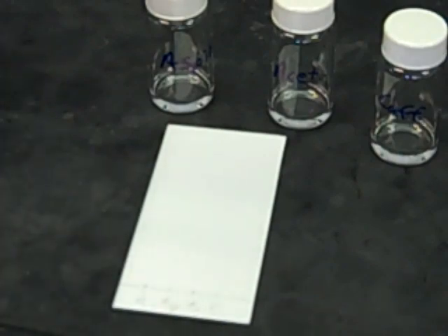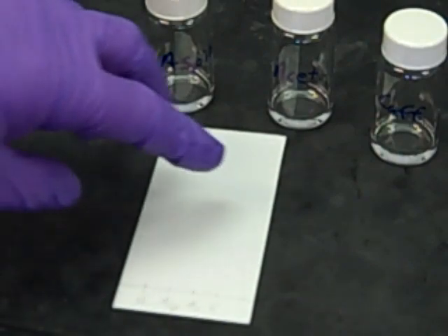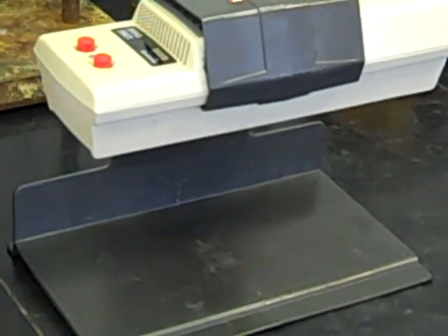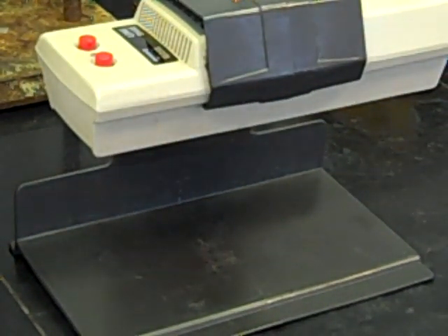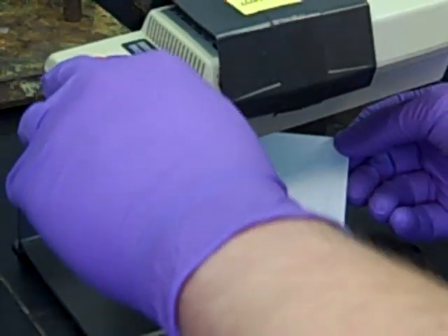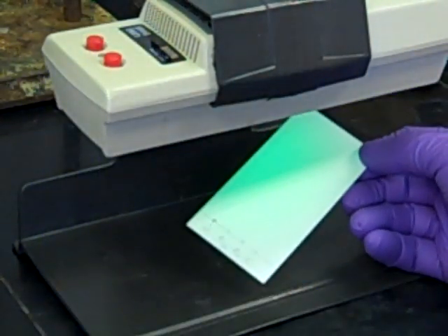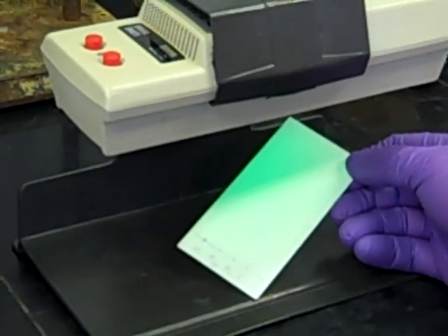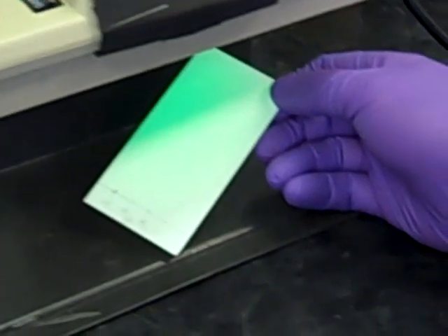If you're curious to see if you put enough on there, take this plate—I've just put the unknown on—and come over to the UV light to check if the plate is absorbing on that spot.